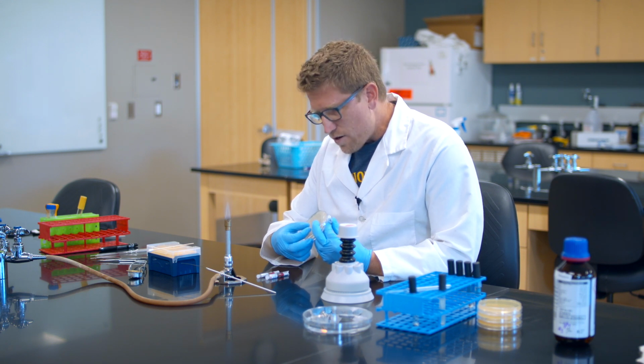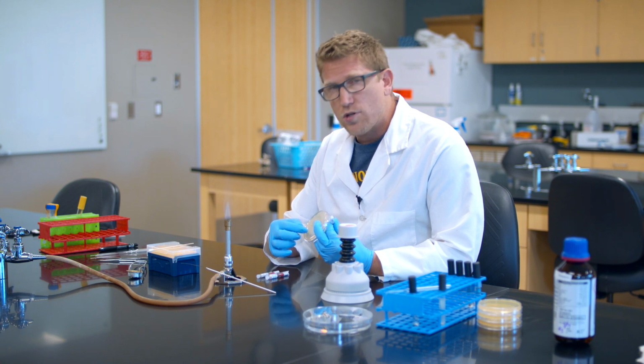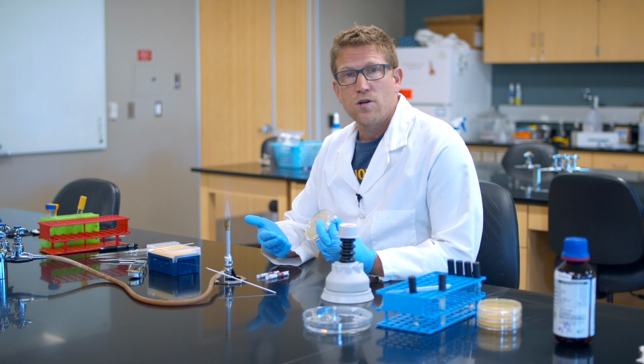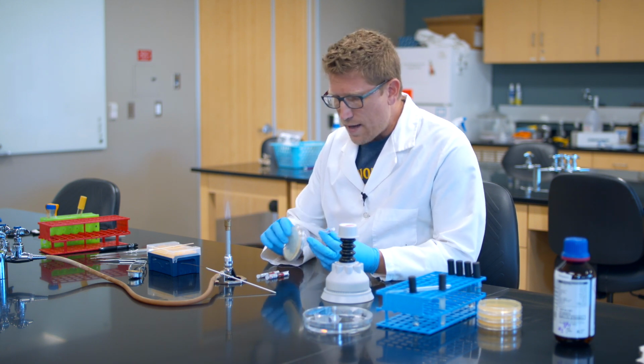And in another video, or maybe later in this same video, depending on how we edit it, we're going to show you then how to measure those clearing zones and how to interpret the result as either susceptible, intermediate, or resistant for that strain of bacteria and that particular antibiotic.